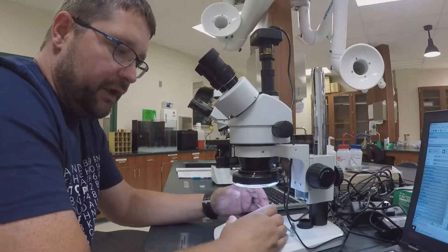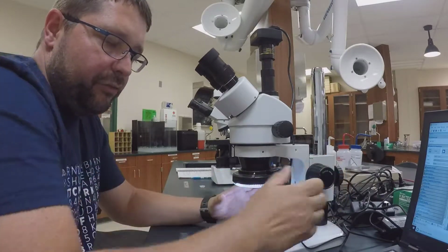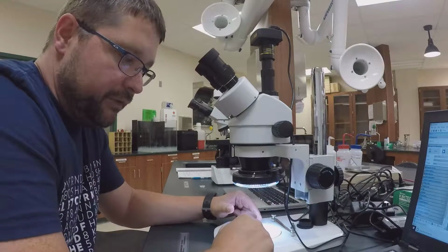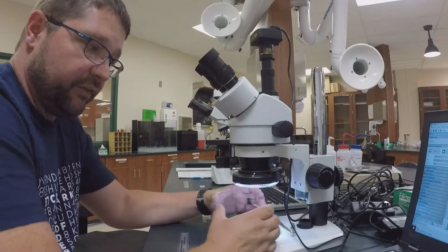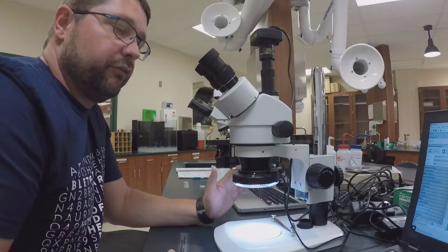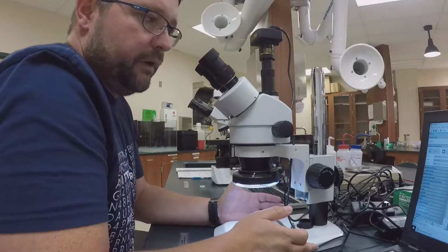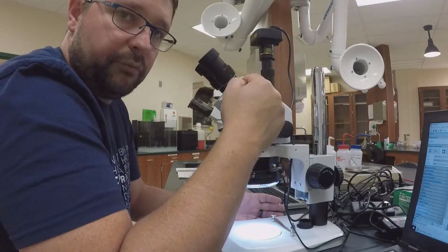A lot of times you're just going to have the head of this microscope far enough away from your object for you to get the object underneath. If it's an insect or a plant, you don't want it right on top of it, crushing it, so you want to give it some space, and I have plenty of space here. I have it at 4 times 10, so 40 times my eyesight.